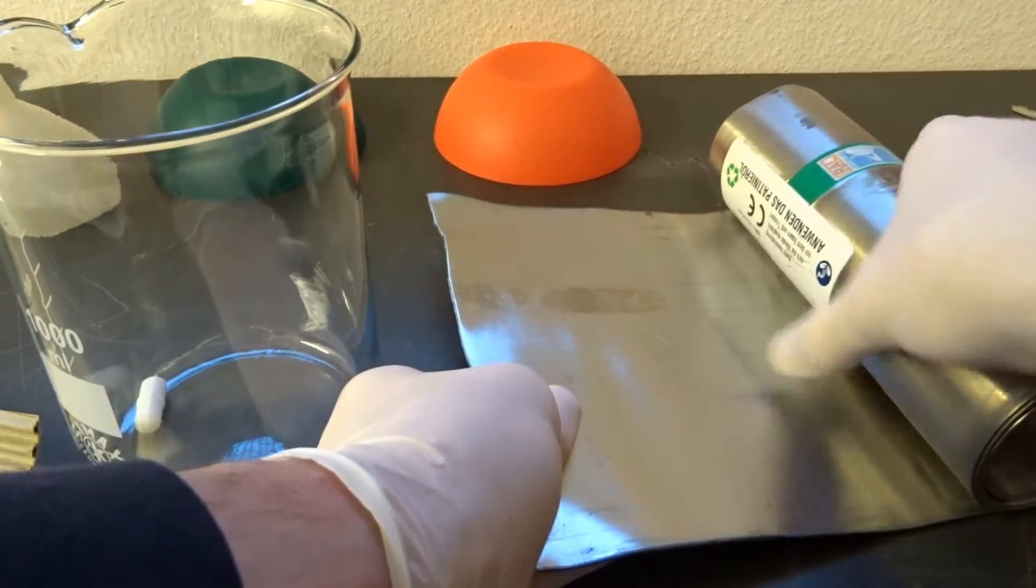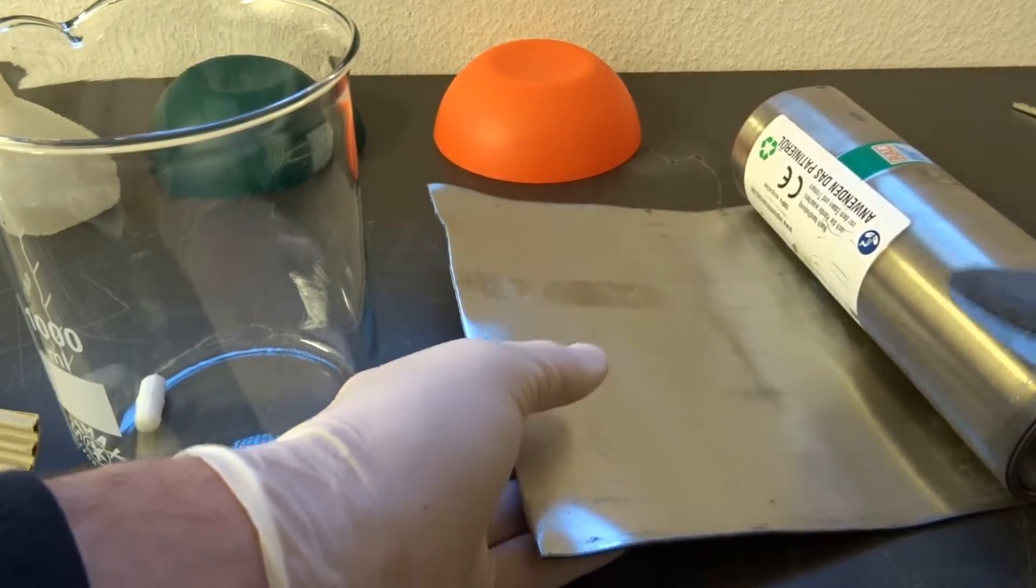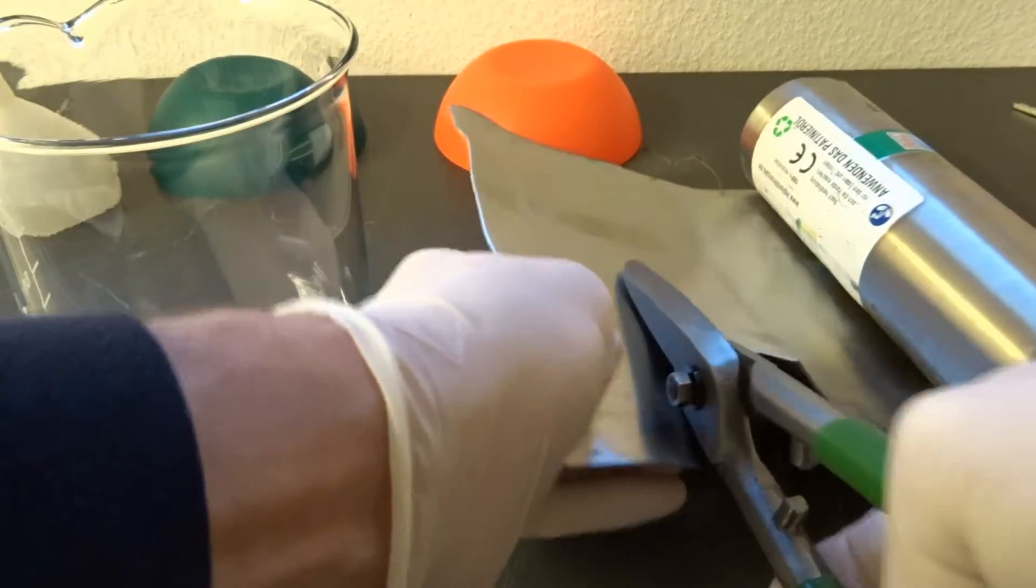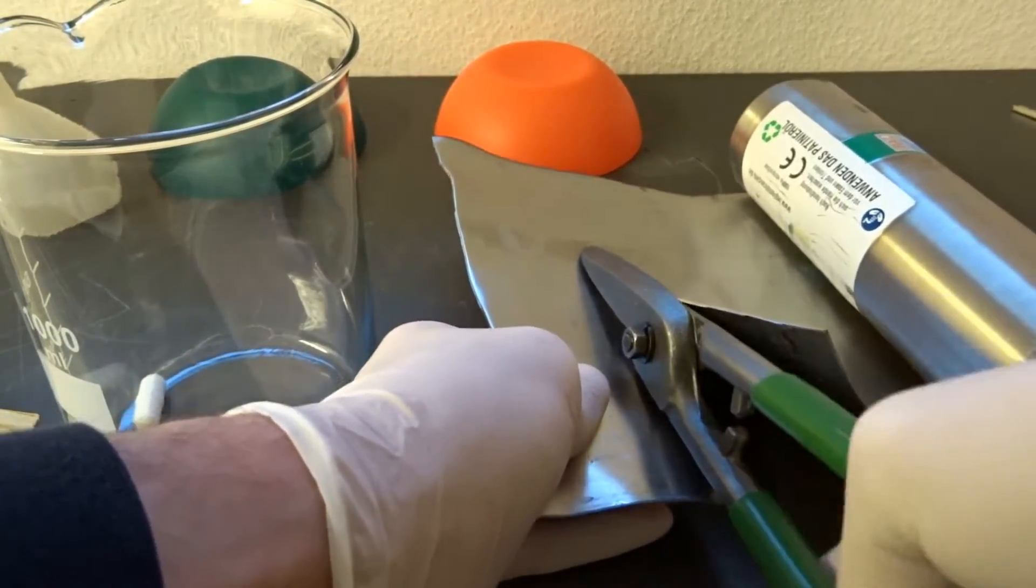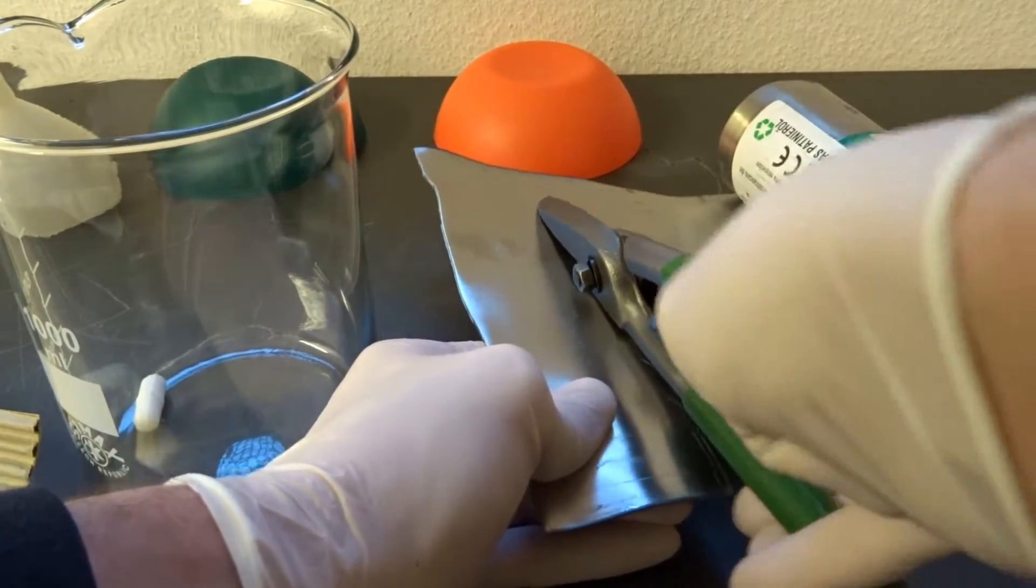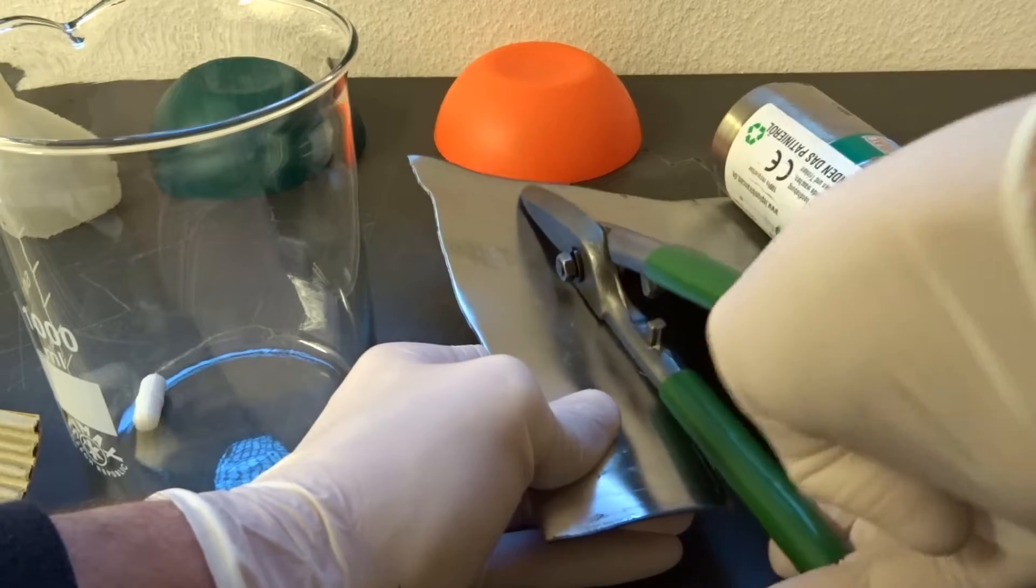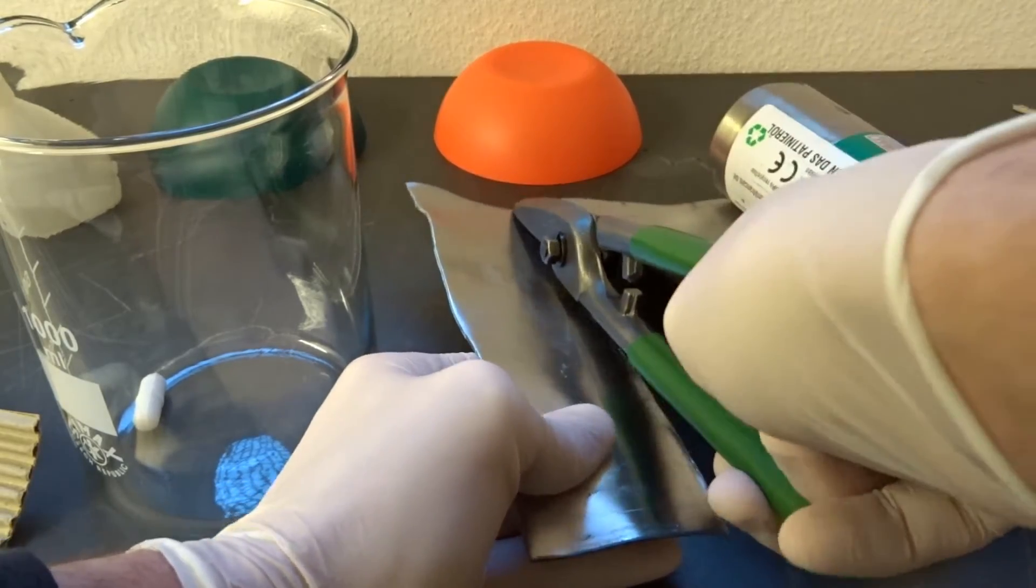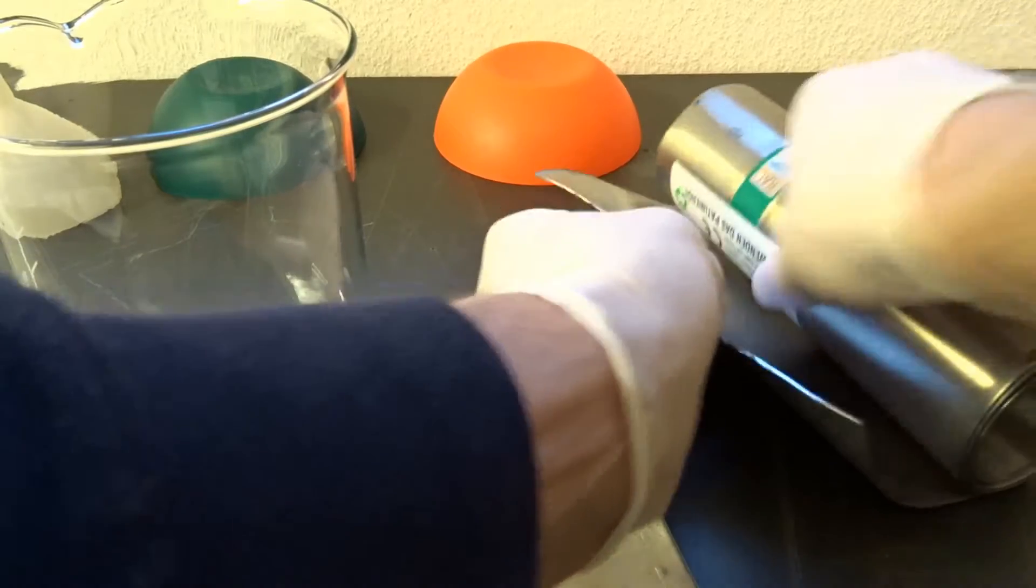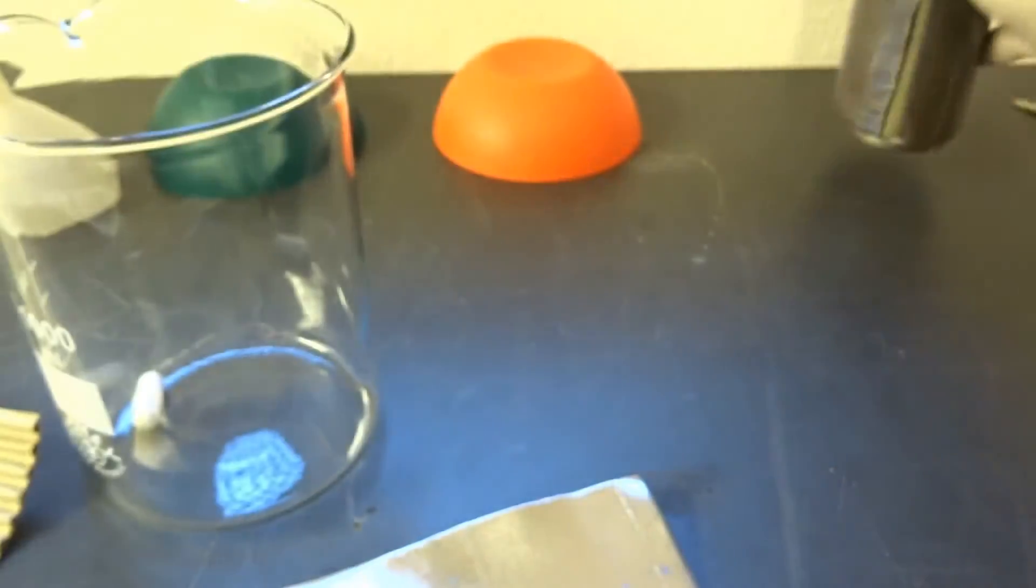Buying this already pre-machined lead is quite comfortable. One is the anode and one is the cathode. Lead is used in car batteries for exactly the same thing, but instead of manganese sulfate there will be something like dilute sulfuric acid inside.